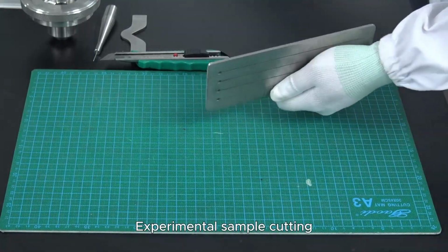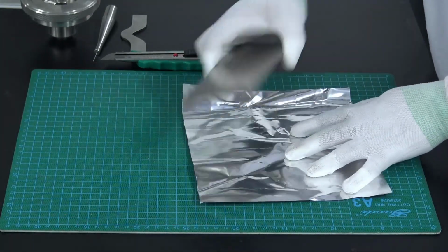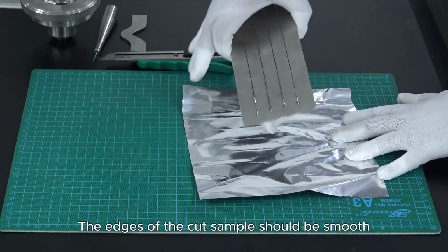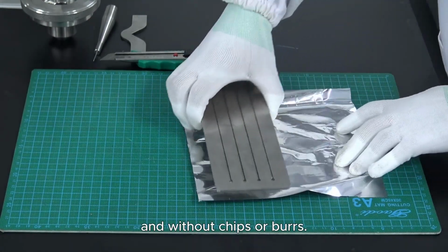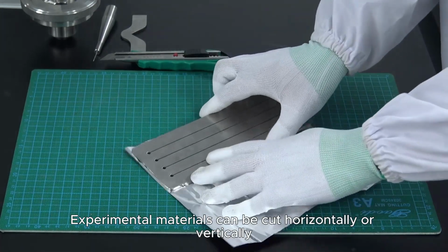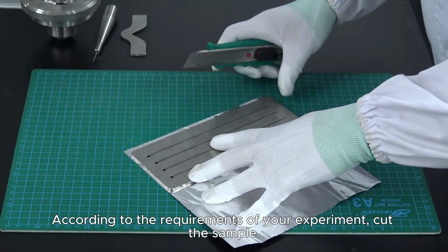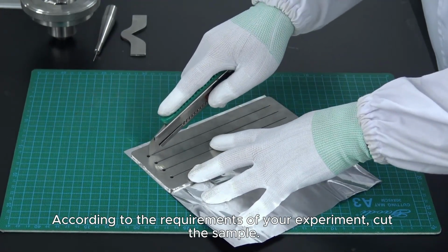Experimental sample cutting. First of all, the cutting tools used for cutting must be sharp. The edges of the cut sample should be smooth and without chips or burrs. Experimental materials can be cut horizontally or vertically. According to the requirements of your experiment, cut the sample.